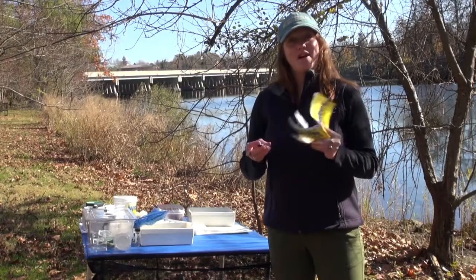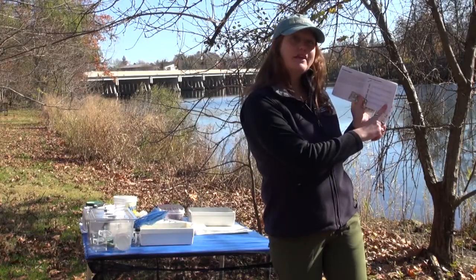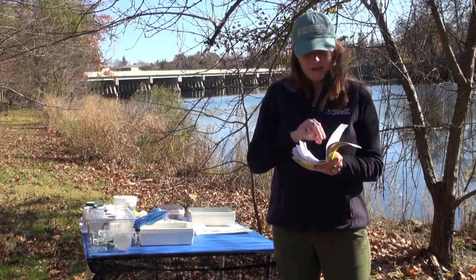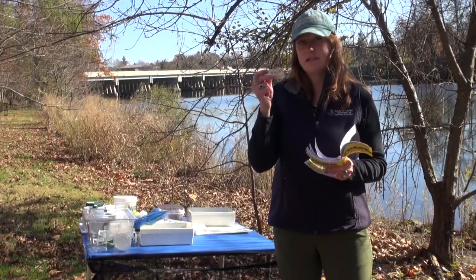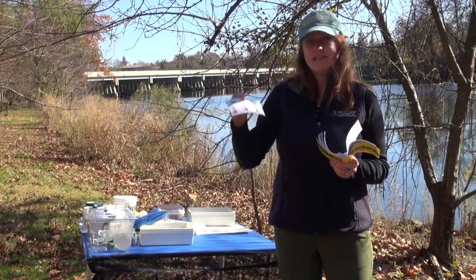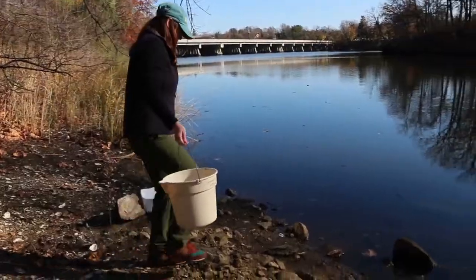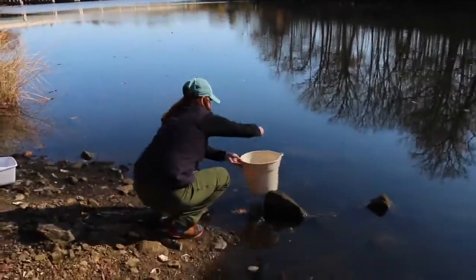I have my dissolved oxygen testing kit here, which includes a manual with instructions for each step. I have a vial to take a water sample, tablets — two of which I'll be putting into the test tube — and a color key to assess what my dissolved oxygen level is. We've already grabbed a bucket of sample water from our area, but you can do this in many different ways.